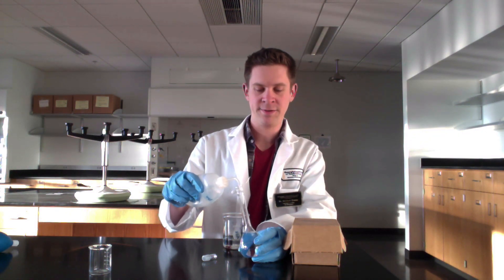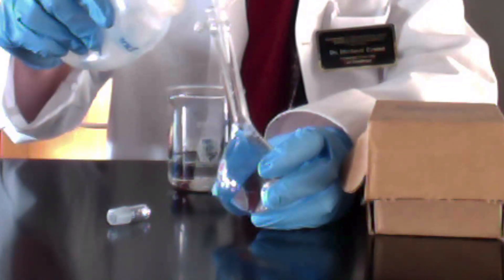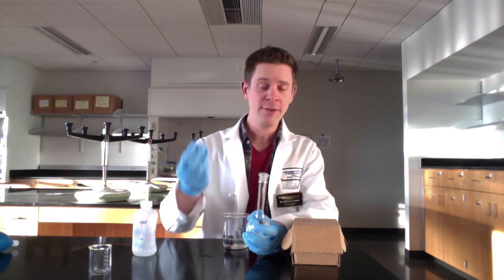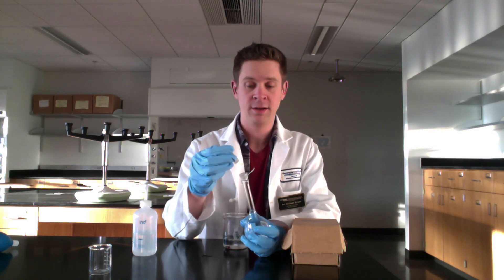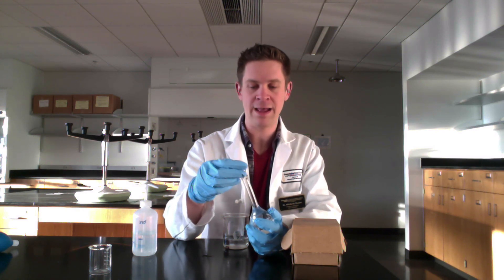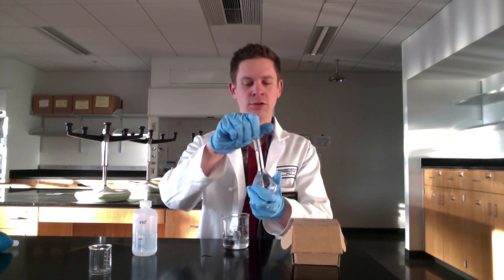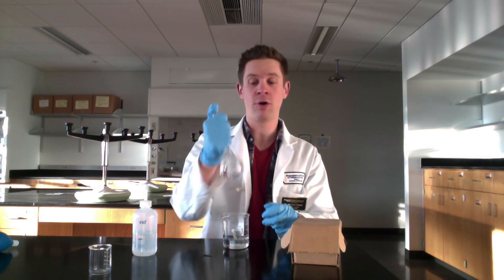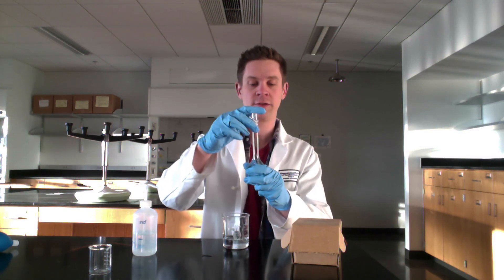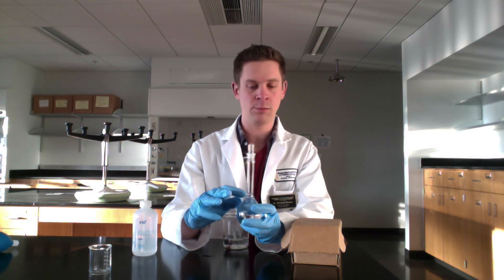I like to fill it until the liquid gets just to the neck — things move up much more quickly once it reaches the neck. At this point, we want to make sure the solution is well mixed. You don't want a heterogeneous solution; you want it the same everywhere so you know what to expect when you pour it out. Also, when the solute dissolves in the additional solvent, there may be volume changes, so we want everything well mixed so any volume change has worked itself out before we reach the final liquid level.